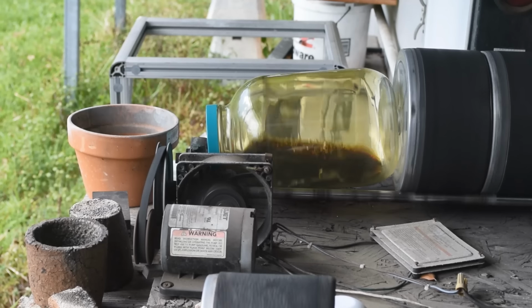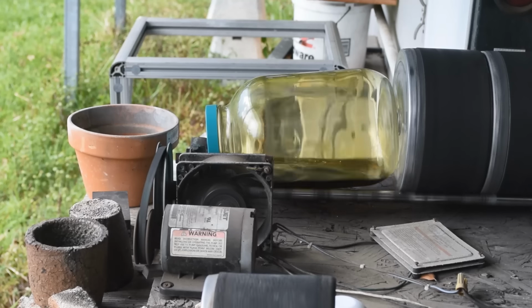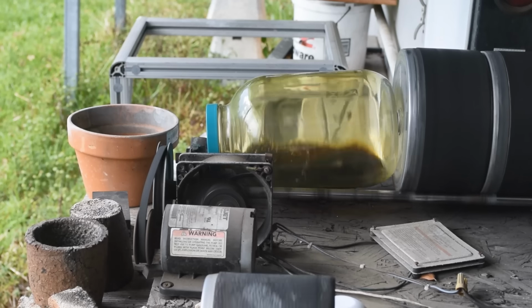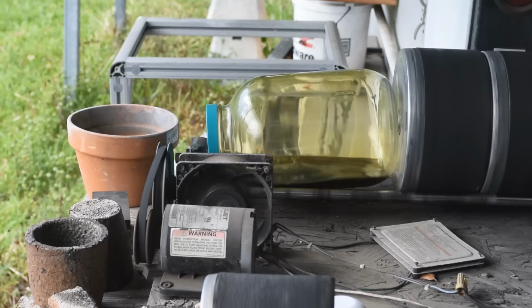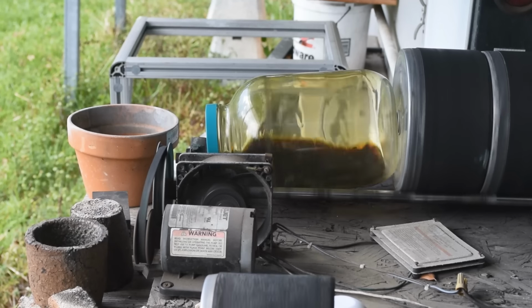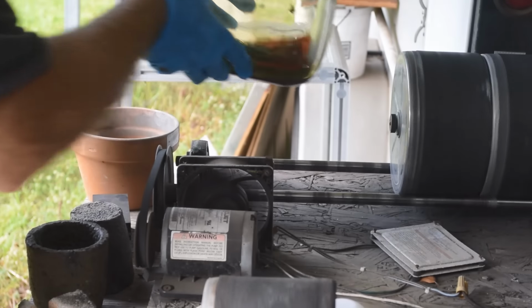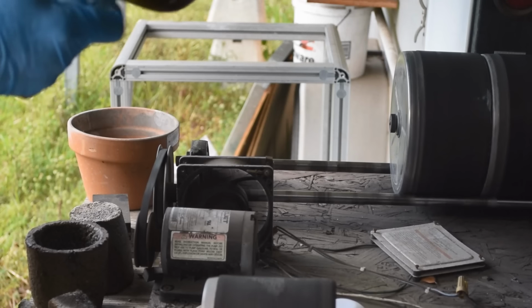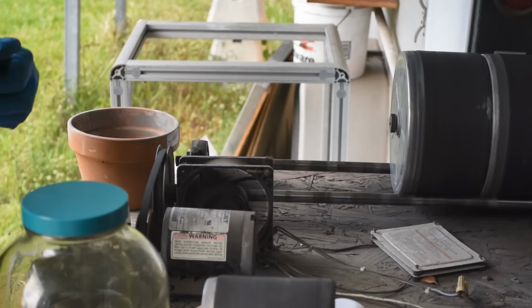So in about 10 more minutes, I'll pull that off and dump the liquid off. I'll have a quick look at the pins, and then start it with a second treatment and see where that gets us. But yeah, this is actually completely by accident. This is working better than I expected. I like that. All right, 15 minutes is up. Let's go over to the other bench, pour this off, and have a look. I can tell a lot of the gold is gone already, but not all of it. So let's go have a look.